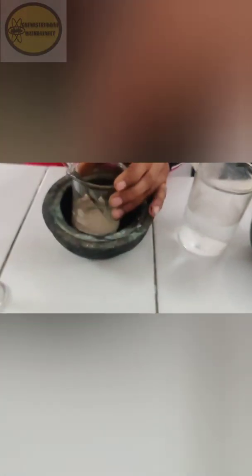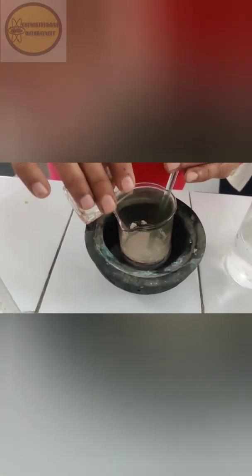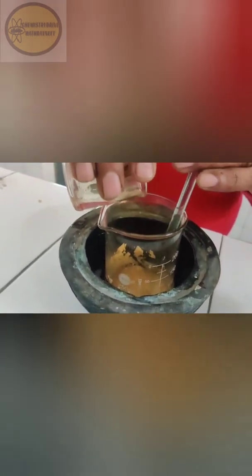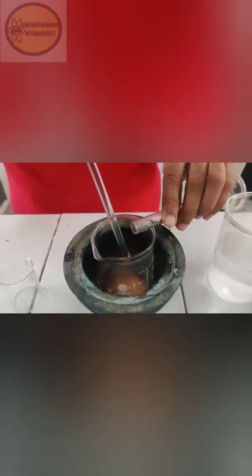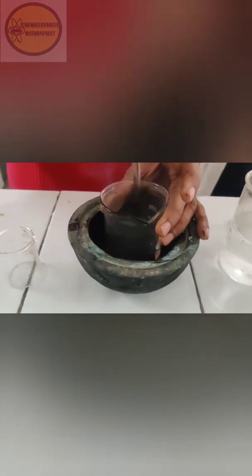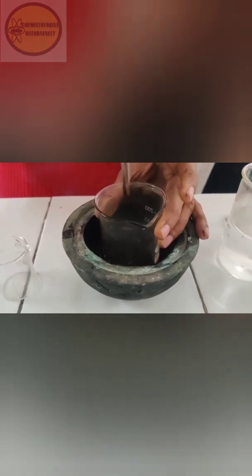Now perform the diazotization: add the sodium nitrite solution slowly to the anthranilic acid solution with constant stirring. The diazonium salt is now prepared. Once diazotization is complete, perform the coupling reaction: add N,N-dimethylaniline in small amounts to the diazonium salt with vigorous stirring, keeping the reaction mixture at 0 to 5°C. Maintaining below 5°C is required for both coupling and diazotization.